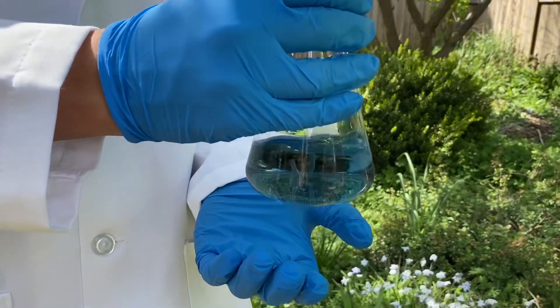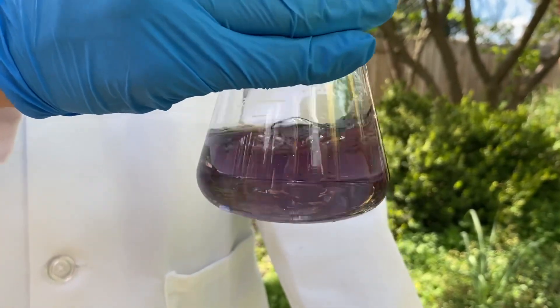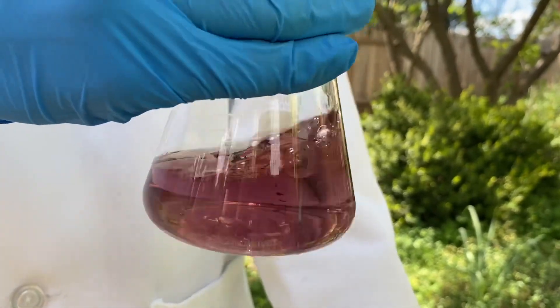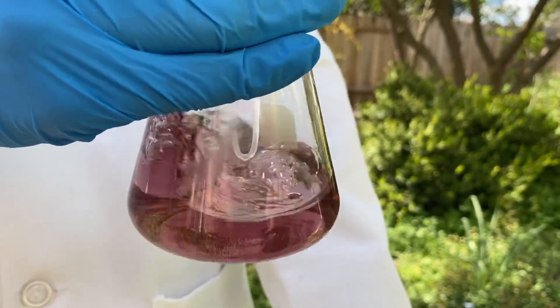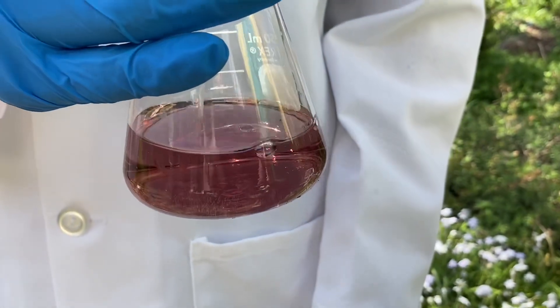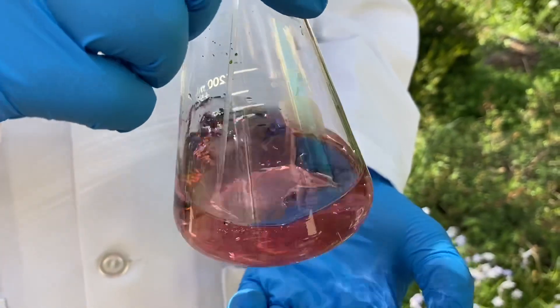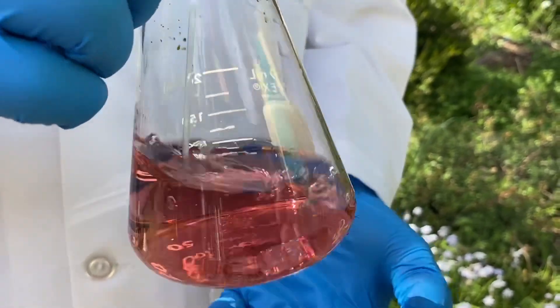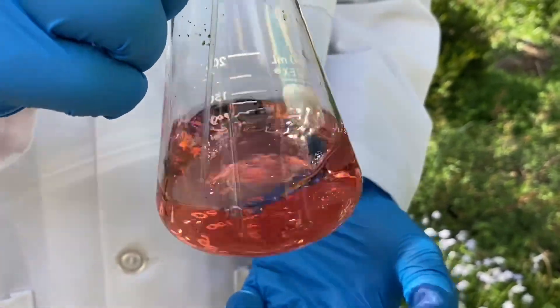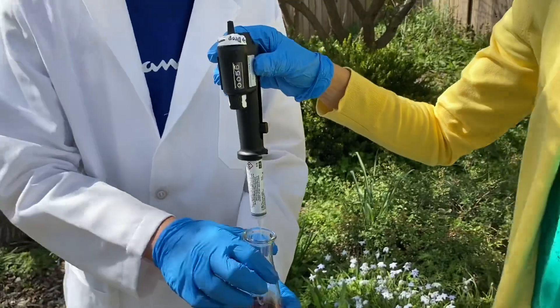Did you see a little flash of pink? Now it's turning pinker. Looks like it's still kind of purple, but we want a nice pink color. Let's look at that on your lab coat in the light — yeah, now I see it, it's a pink. So we're at 54 now. I'm going to give it one or two more and just see if it gets lighter. That's a little more pink, I think. This looks like it's the right one. I'm going to say 55, but I'm going to give it one more just to be sure.